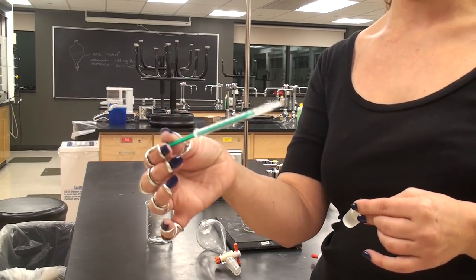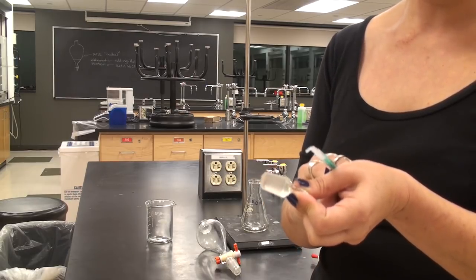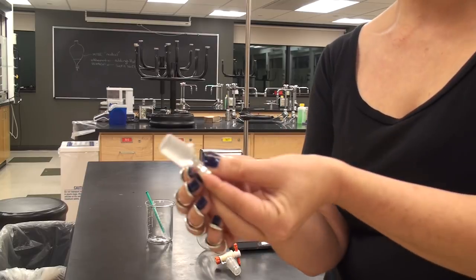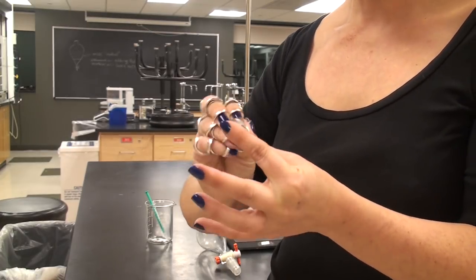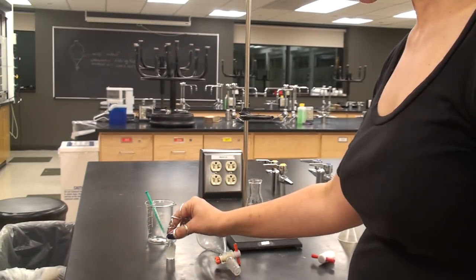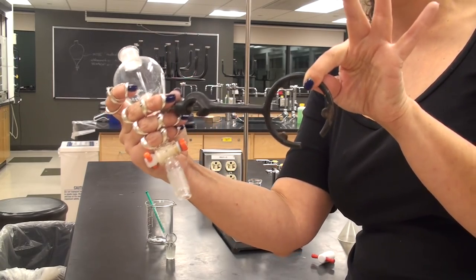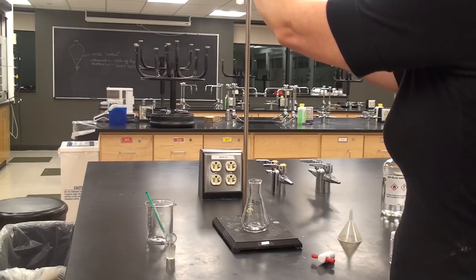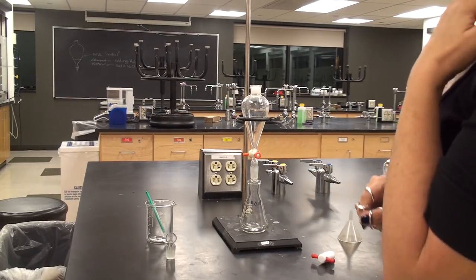Apply the grease to the upper portion of your stopper and push it around with your finger to coat all the way around. When done correctly, the greased area will have a wet look, indicating the cracks are filled. To suspend the separatory funnel above your flask, use an iron ring — these are underneath the sink cabinet along with the ring stands. Set it high enough that an Erlenmeyer flask fits underneath, and you're good to go.